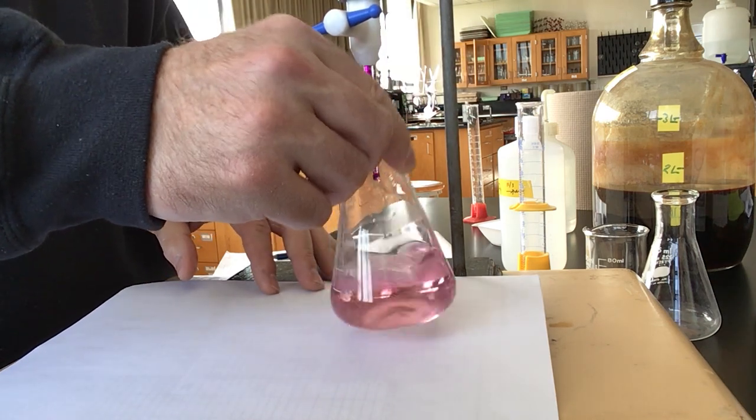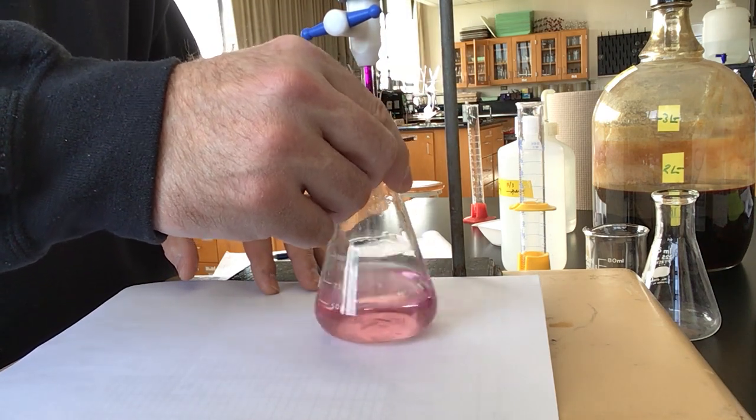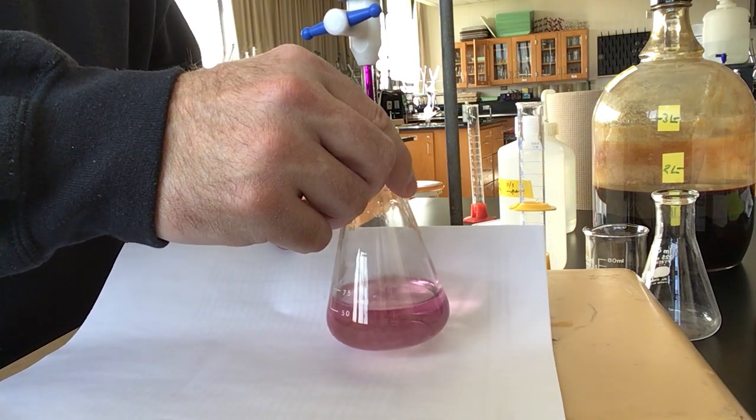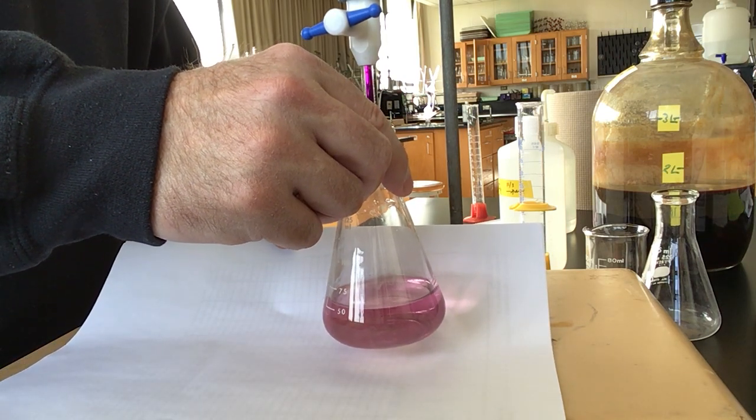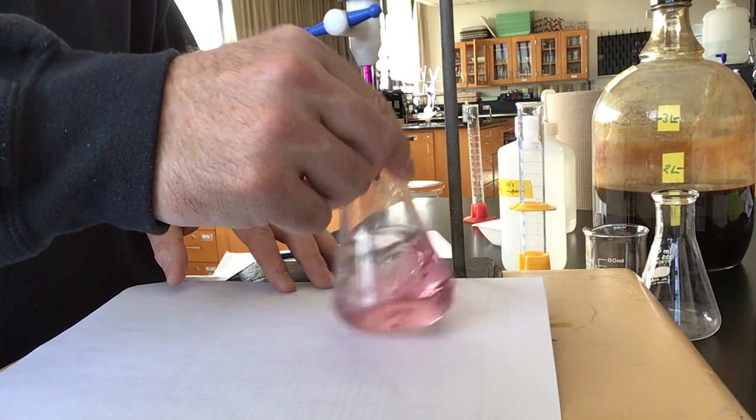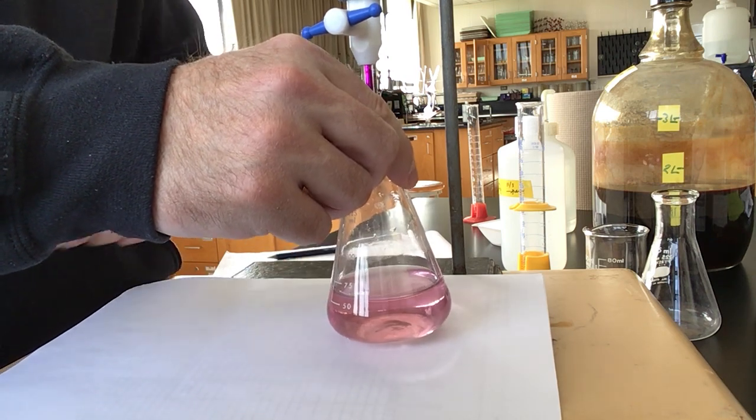Alright, looks like it's taken on a kind of a pink color. You can see that a little bit better there. And we'll see if it persists for about 30 seconds.